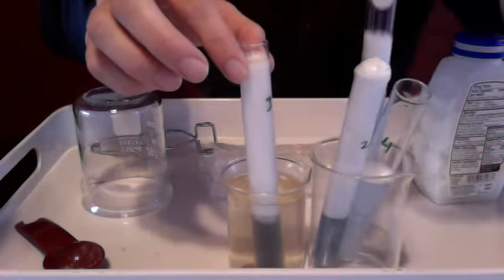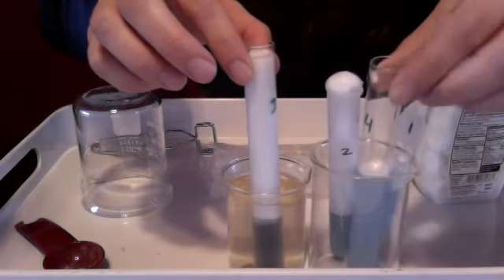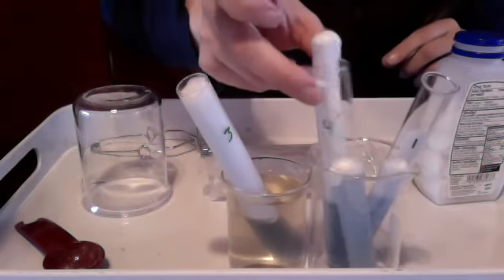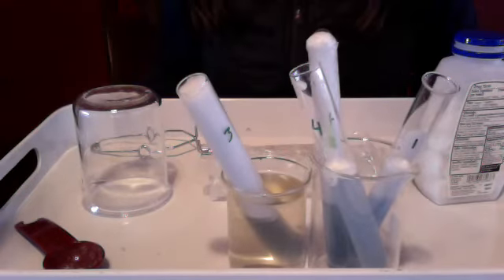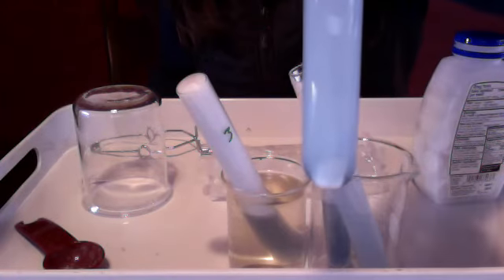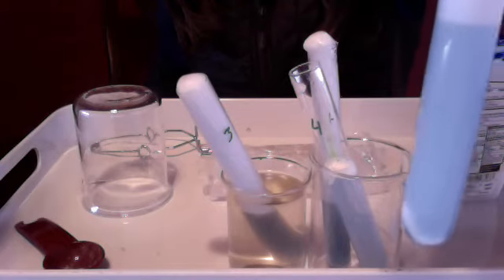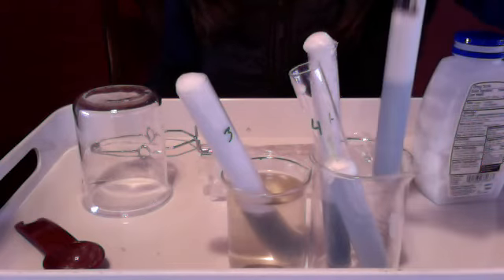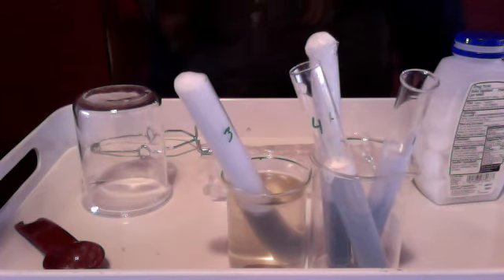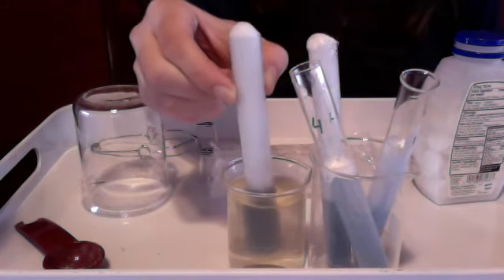Here again is our control. 4, no surprise there, it's just plugging along. Okay, so you need to write this data down: in what order they had the fastest reaction time. 1 is still going. If you can see, this is the reaction, the little bubbles at the bottom. Tums is an antacid. We have a very strong acid with toilet bowl cleaner, comparable to your stomach. So when you take Tums, it should make you burp because it's neutralizing your acid, and as it neutralizes it, it's giving you some gas.